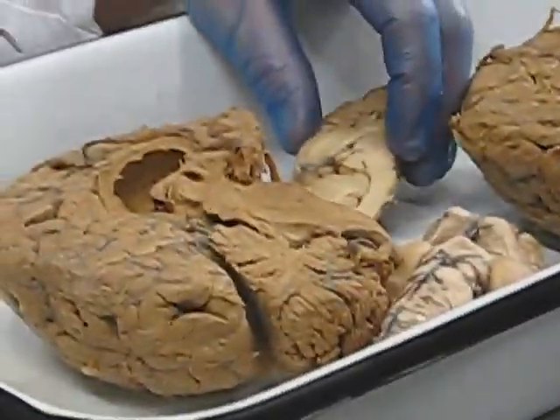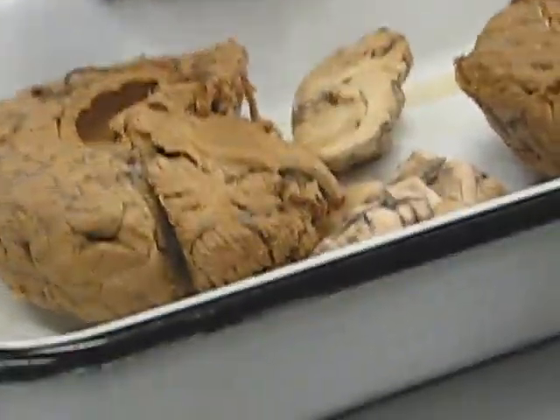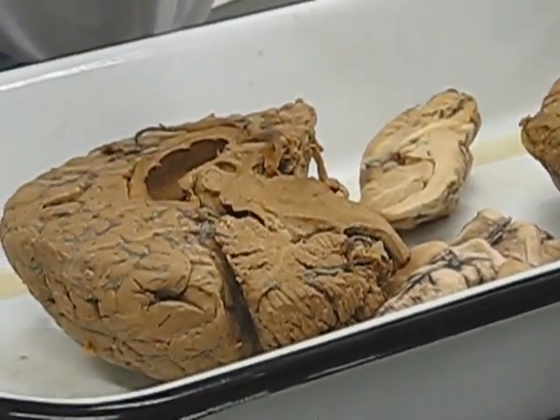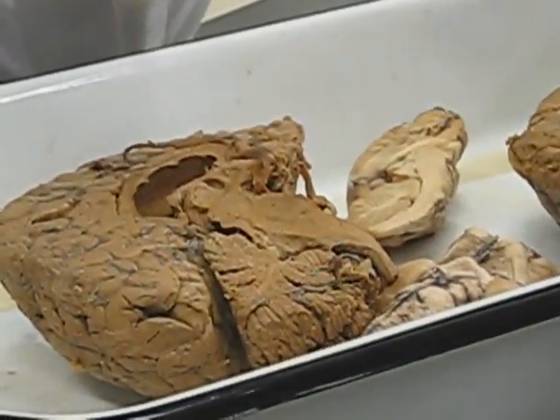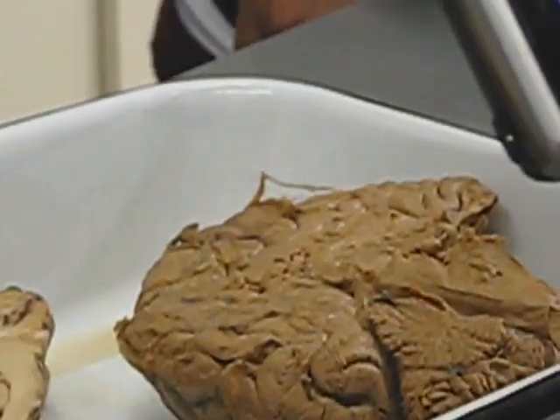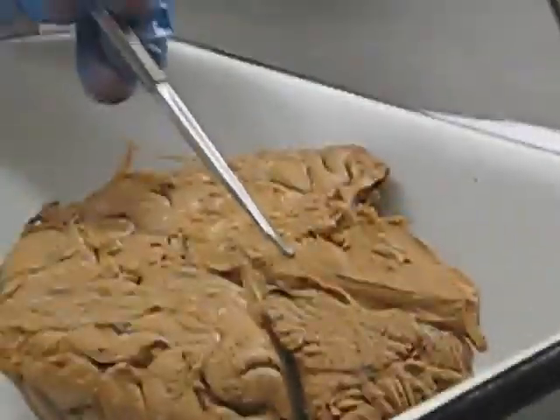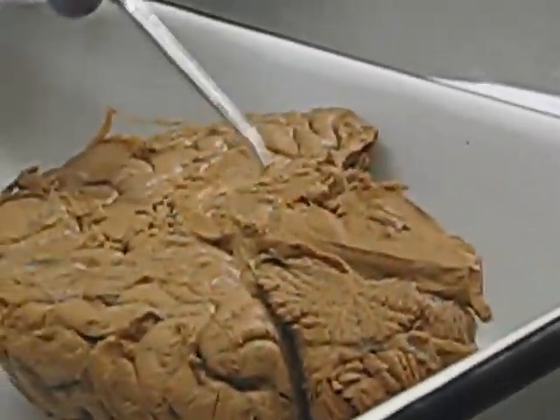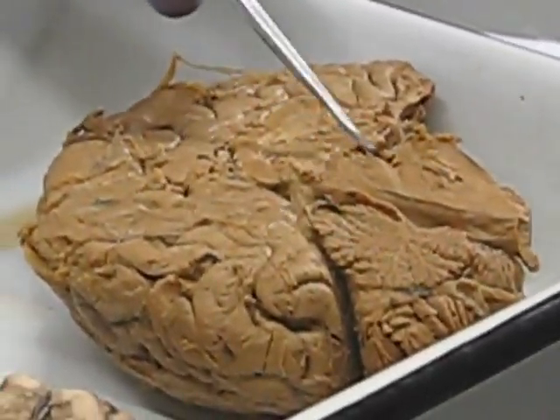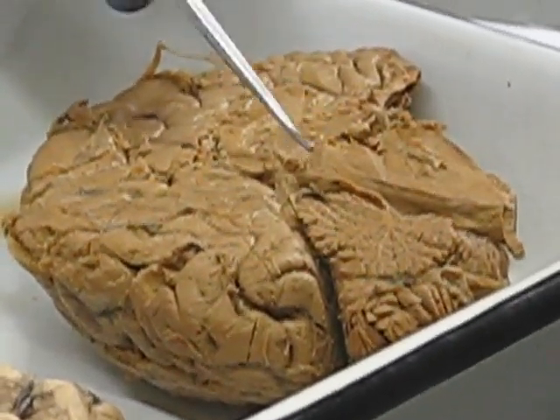Okay. The brain stem. Here it is. The brain stem is made up of three things: the midbrain, the pons, and the medulla oblongata. So here we go with each of those. We find the midbrain by looking for the cerebral aqueduct. There's the cerebral aqueduct right there. It connects the third ventricle with the fourth ventricle, and everything around that is midbrain. So the midbrain is part of the brain stem.